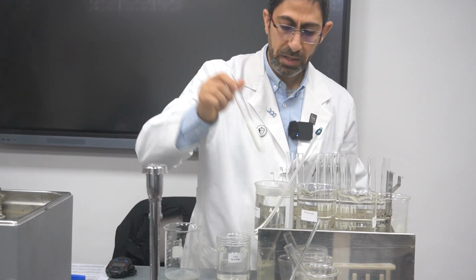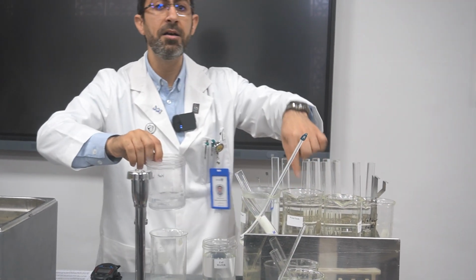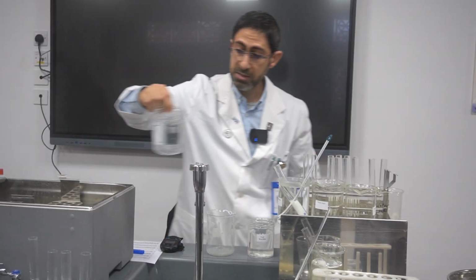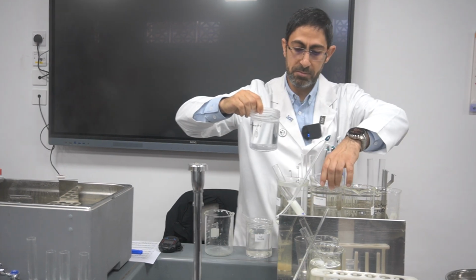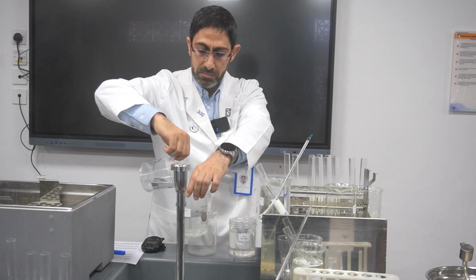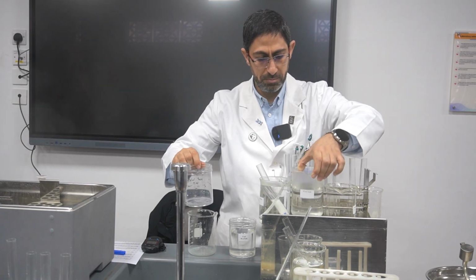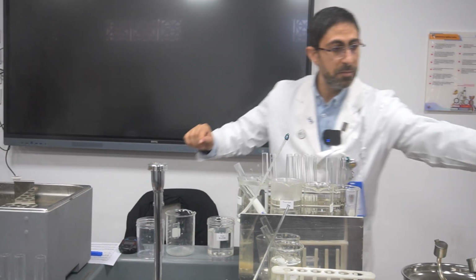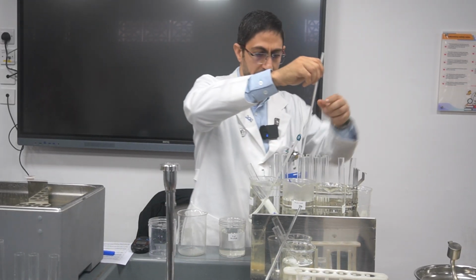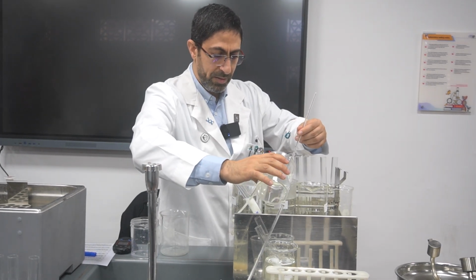Here is the X, and I place it here. At the same time, I can make use of time. I make another run here for 60 degrees Celsius. I have to actually take care. If you bring me a thermometer, please, I'll be thankful. Thank you. This is room temperature. Yeah, it is 20.